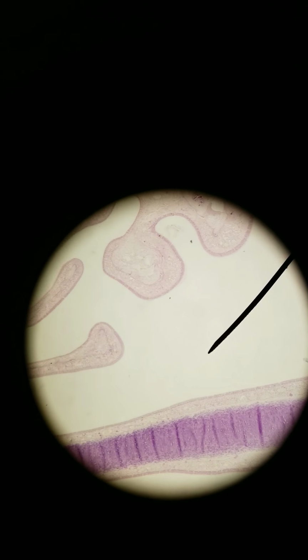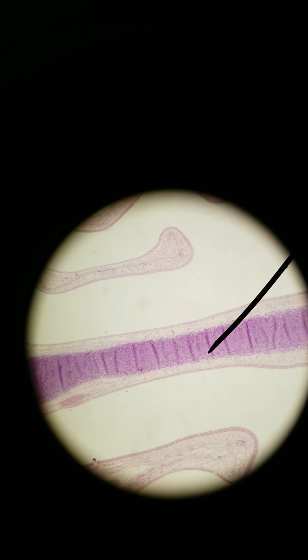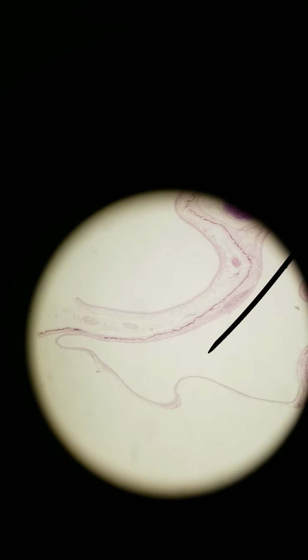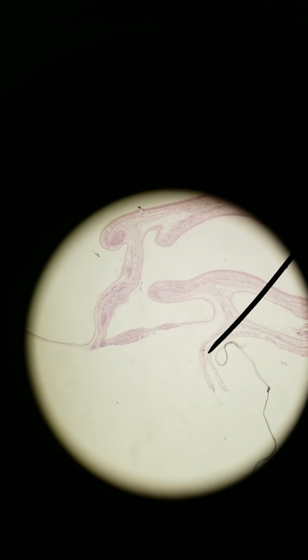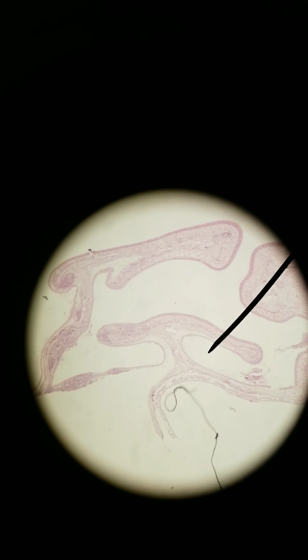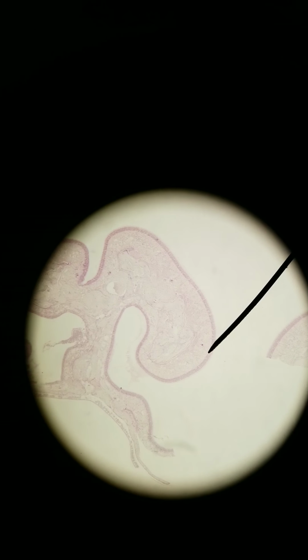It's very circuitous because we've got this midline of cartilage, it's hyaline cartilage, we'll take a look at in a minute. And all these things make up your turbinates. Remember turbinates? It's what surrounds your nasal conchae. You need all these folds to help you smell, to help you filter air, humidify, and heat air. And this increases the surface area so that when you take air in your nose, you can do all those things more efficiently. So let's zoom in.